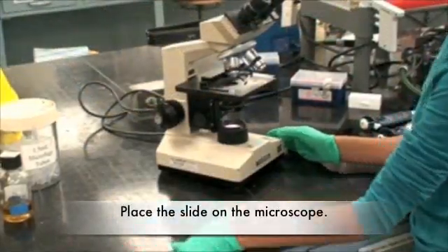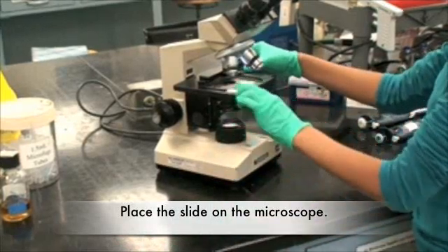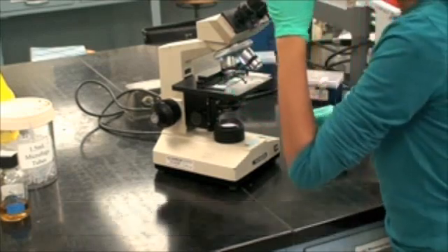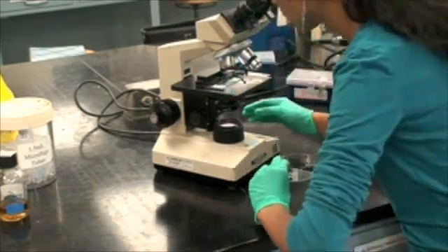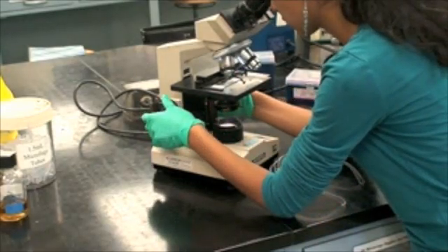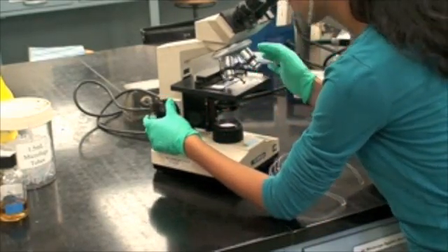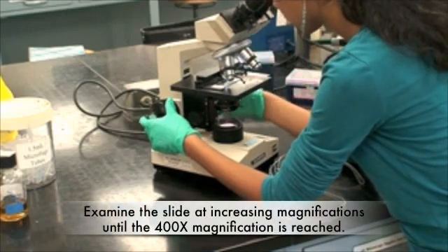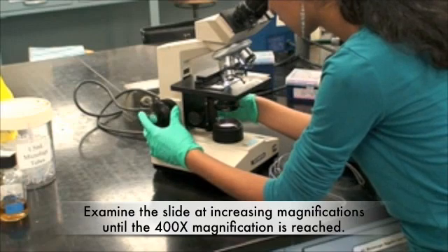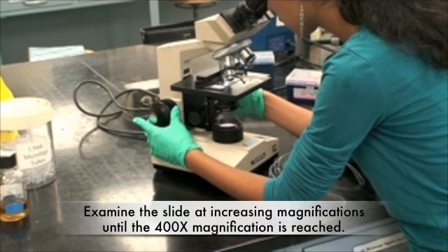Place the slide on the microscope. Examine the slide at increasing magnifications until the 400x magnification is reached.